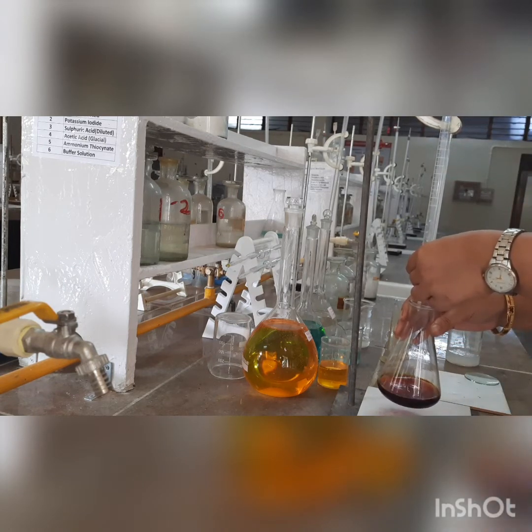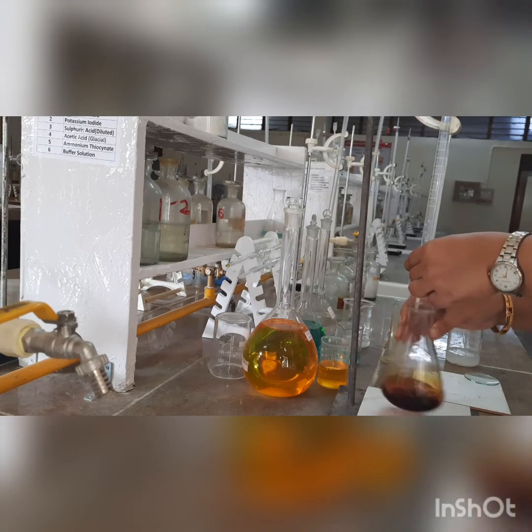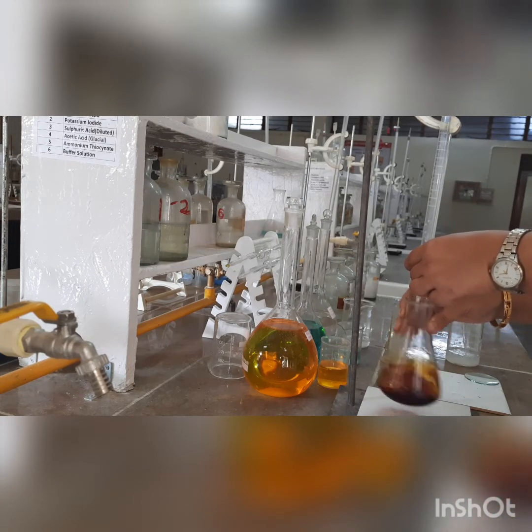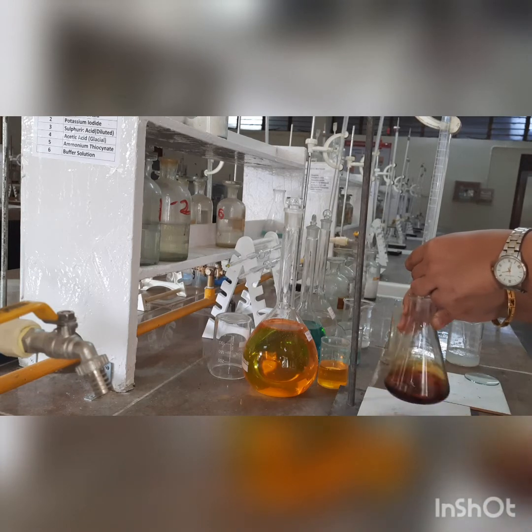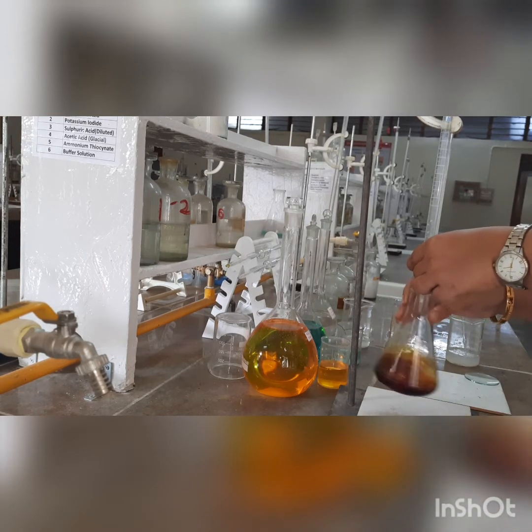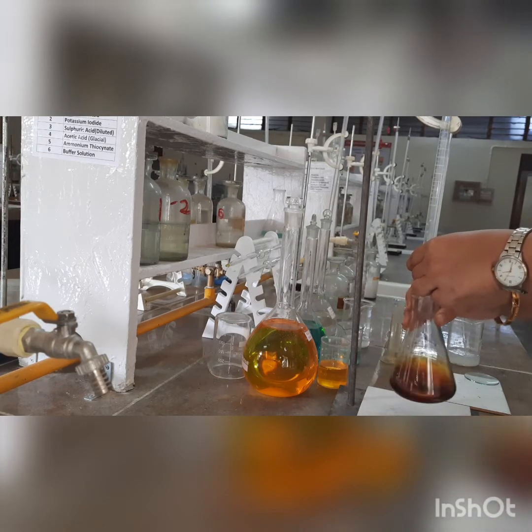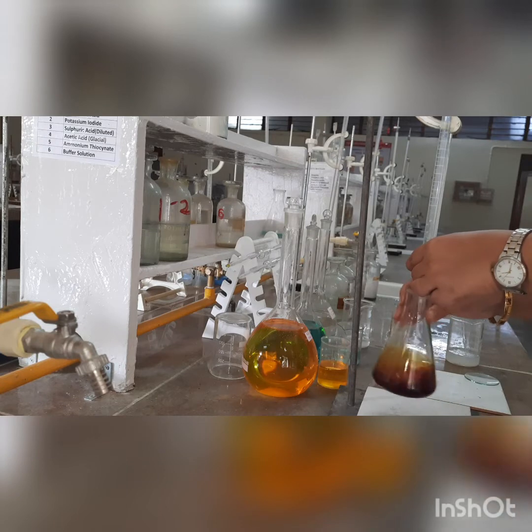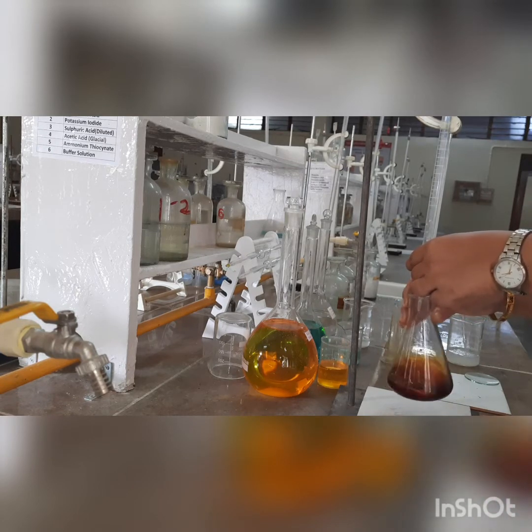Now through the burette, let us add hypo solution. You must have noticed that I have not added any indicator right now, because in iodine titrations we always add indicator near the end point. Starch has a tendency to form a complex with iodine — this is the reason we are putting starch near the end point.